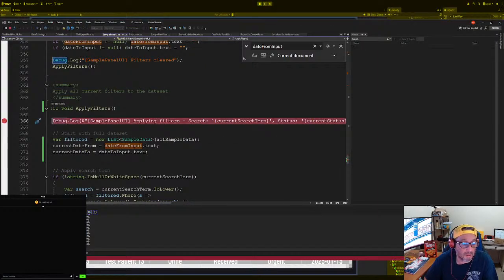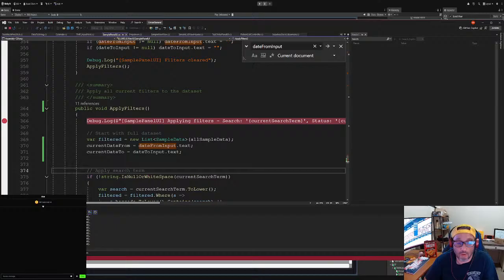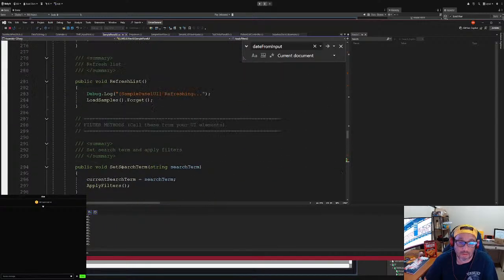Did we change anything? No, because it's a range, right? So, actually, let's go here. Let's go to January 26th. We should get everything unfiltered out. All right, so we have to fix this date range here as well. All right, so let's add some default to it. That way we always get a range. Okay.